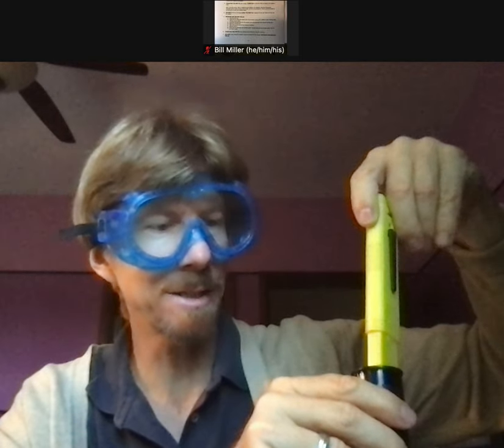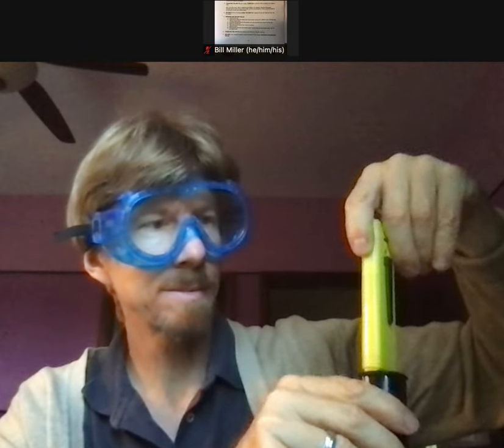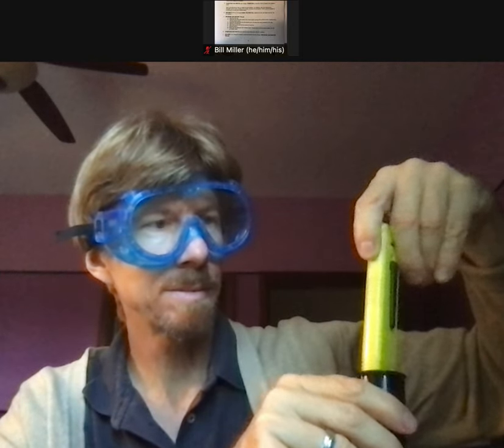It's a little high to be honest — it says around 4.7 but it's changing and going down. I'll give it a stir for a couple more seconds. Still going down — a few more seconds. Now it's actually down into the threes; it seems to have stabilized around 3.8.